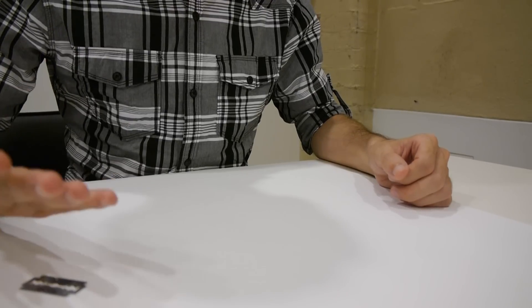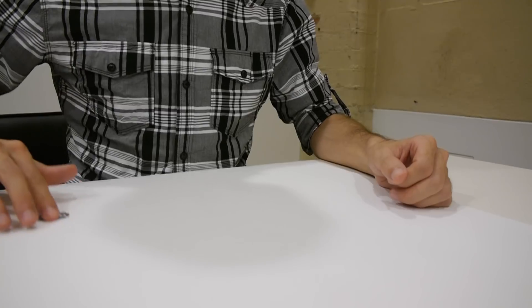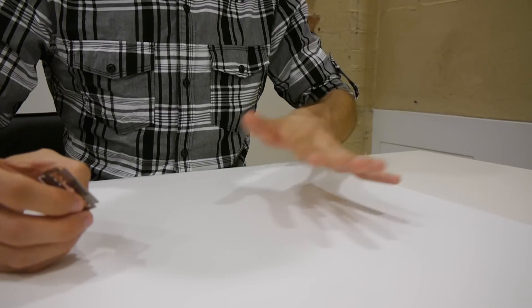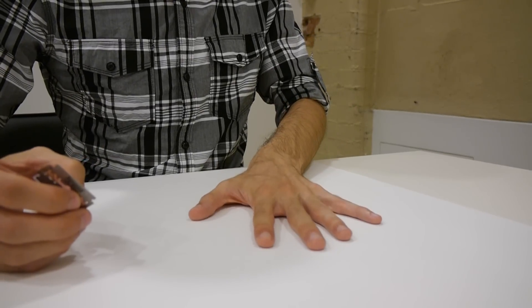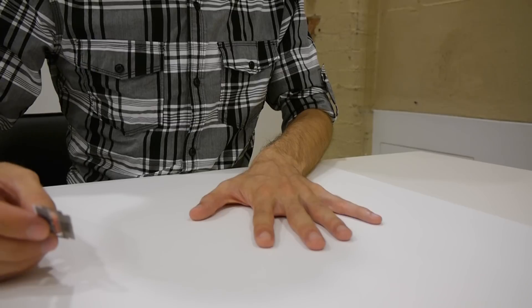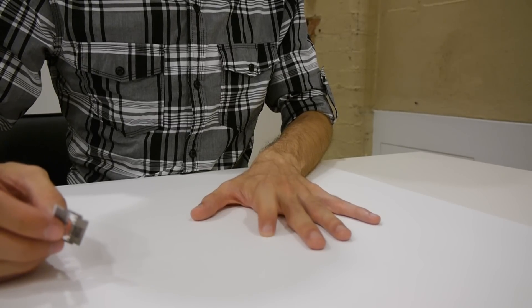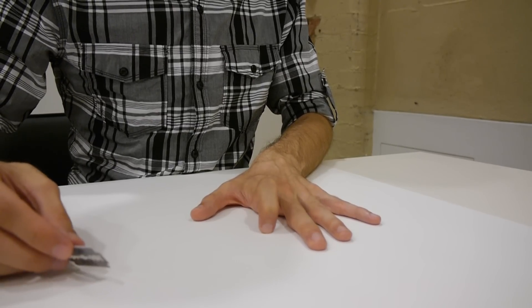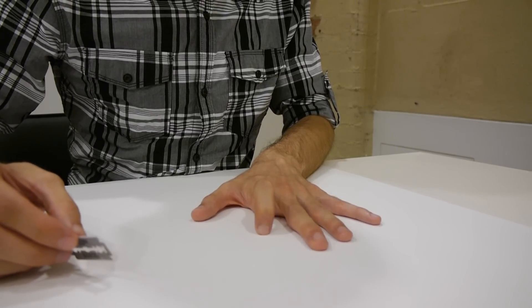I am right handed, so to perform this section I first place my left hand palm face down onto a flat surface. I then lift my left index finger slightly from the surface with only the tip and the finger holding the sample.